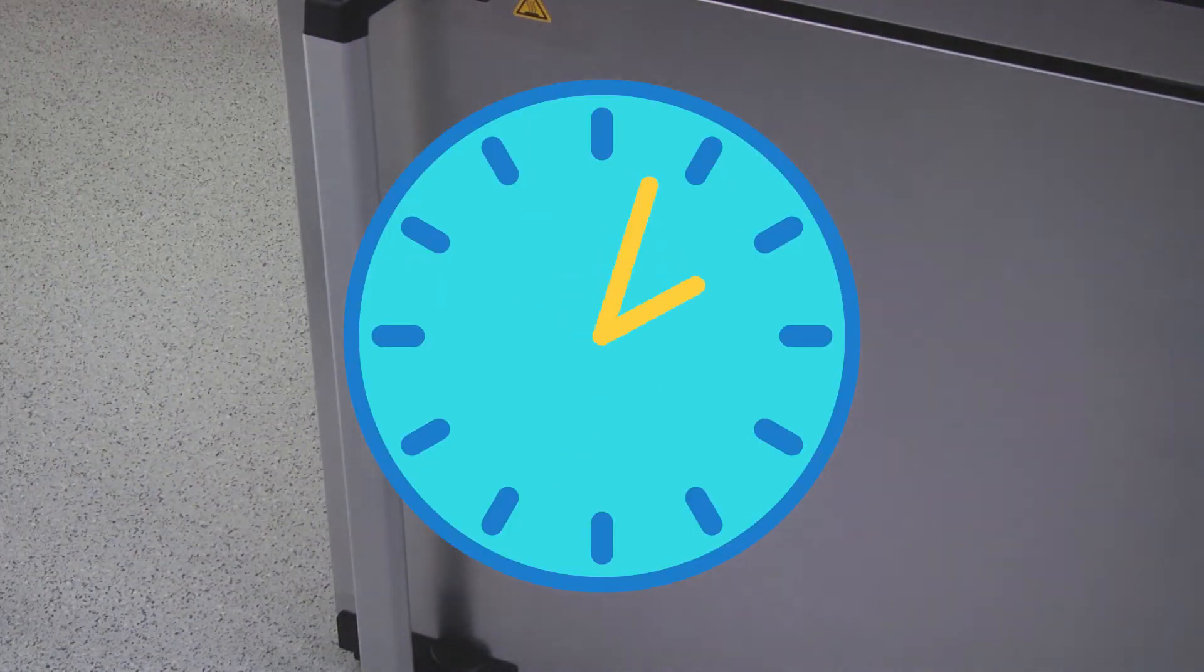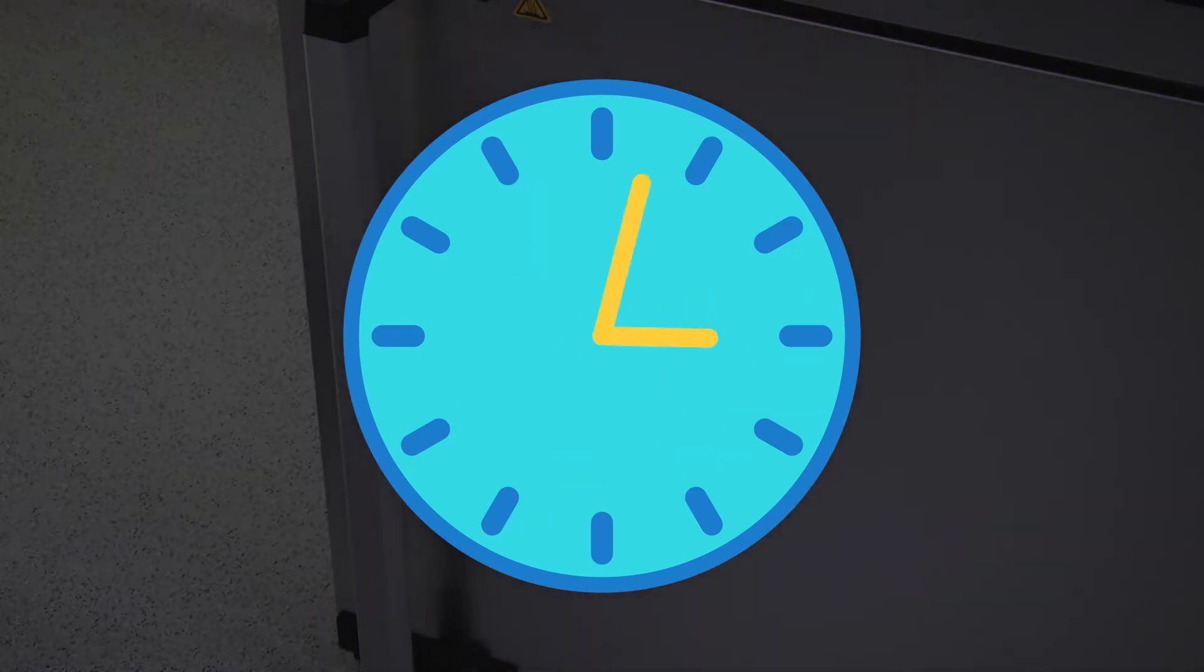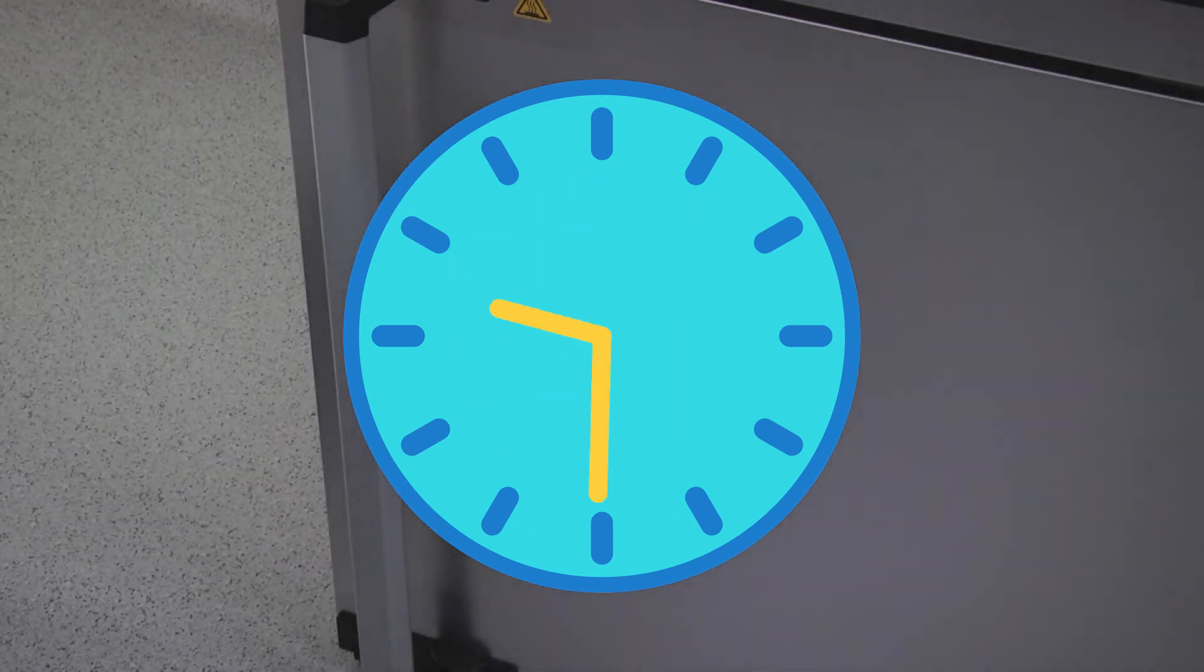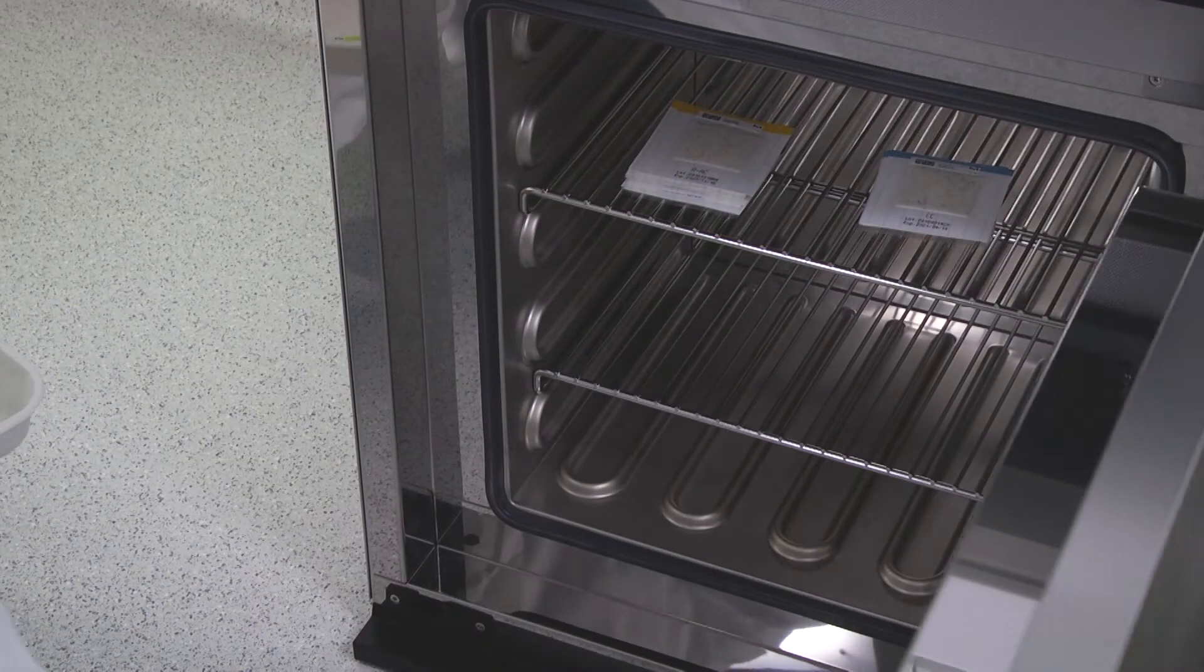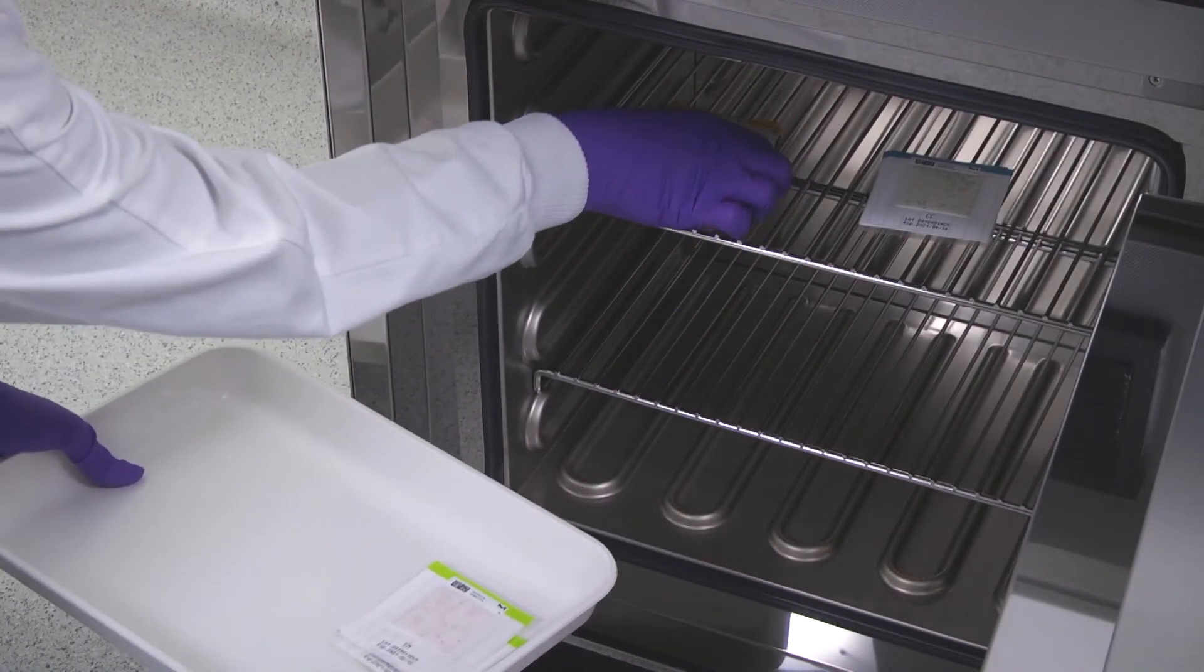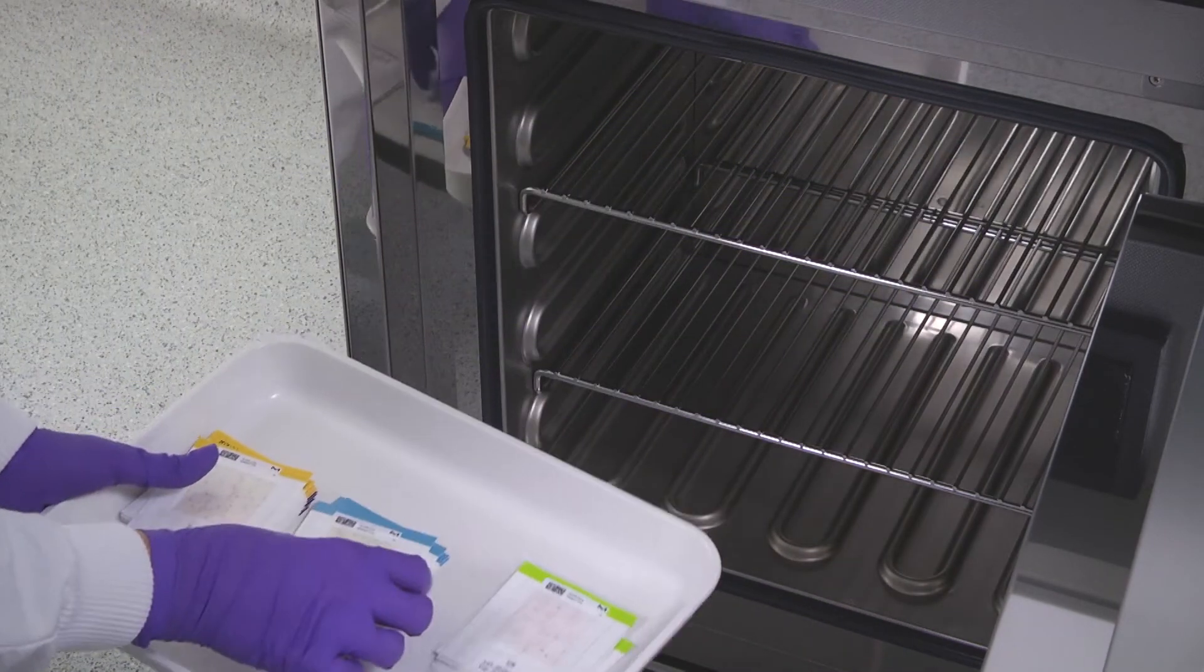Incubate the MC MediaPad tests according to the temperature and incubation time mentioned in the package insert. Some will provide faster results compared to traditional methods. After incubation, take the MC MediaPad out of the incubator to assess the readout.